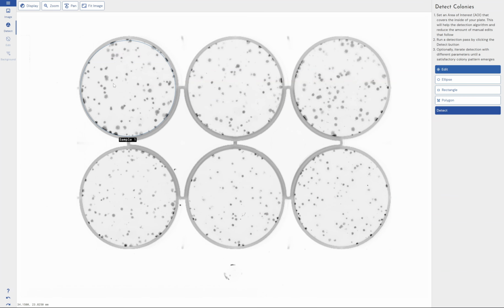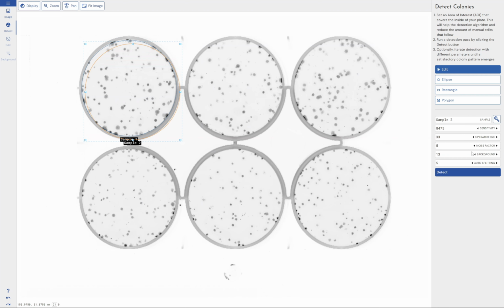So the next step in the workflow is obviously to run our detection. You can see here that I've defined one of my wells and one of my areas of detection already. So once I've defined one area, if using a standardized well, you can then go on to define the others, and you can copy and paste these. So if they're all of the same size, you can just click on here, go on duplicate sample, and then you'll grab sample 2. You'll put it over your sample 2 well. I'm just left clicking and dragging these, and I can edit the size of these shapes just by using the anchors on the side, and I've just scaled them up, scaled them down, things like that.